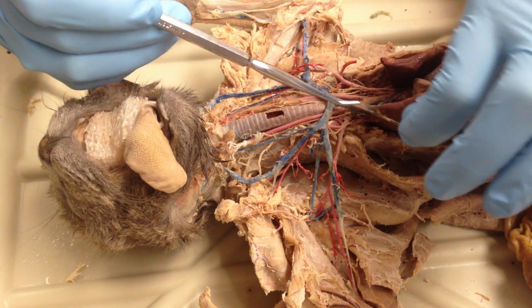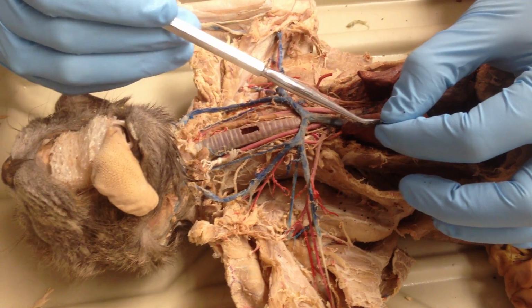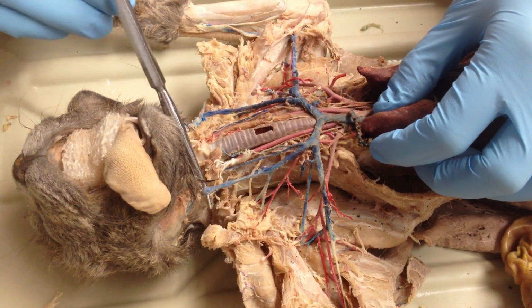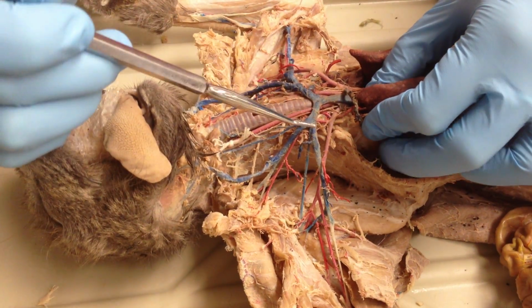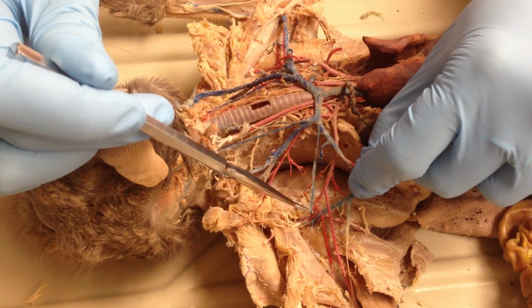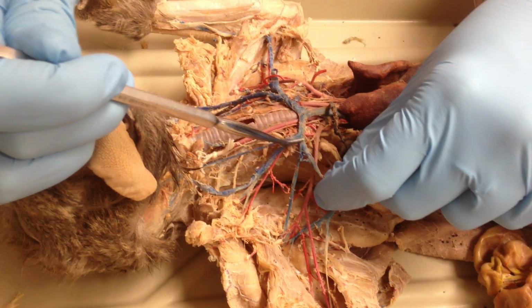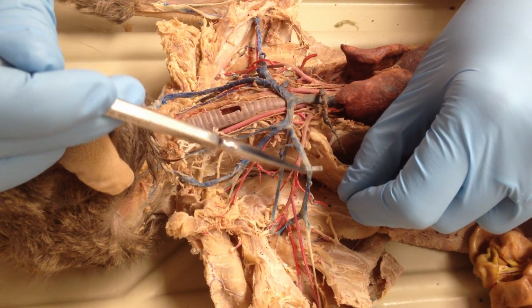Sternal vein is immediately off of that, which turns into internal mammary. The brachiocephalic is the first branch off of vena cava. I have external jugular that goes up, internal jugular along the side of it. Between the brachiocephalic and the subscapular that comes off here, this teeny tiny little portion right here is the right subclavian. And then once that branch happens, now you're axillary.